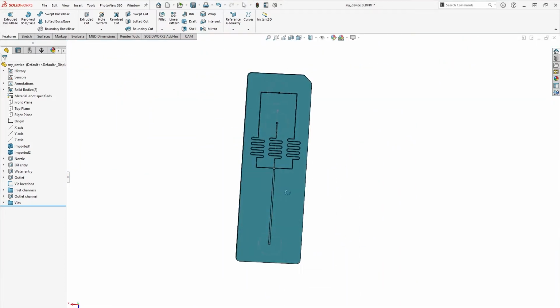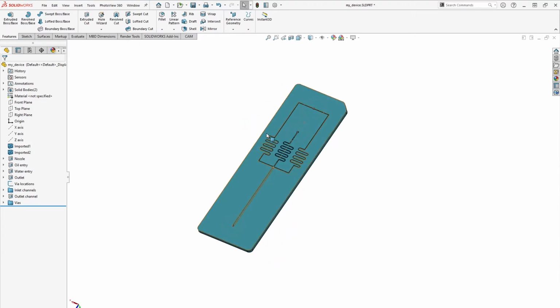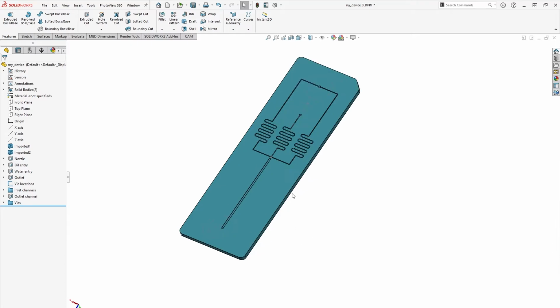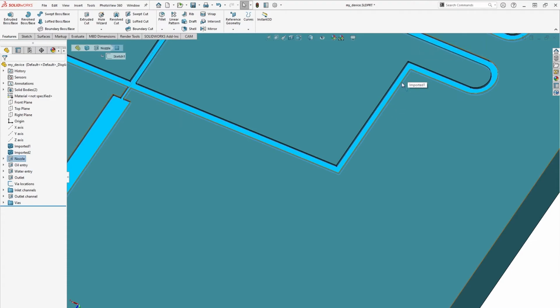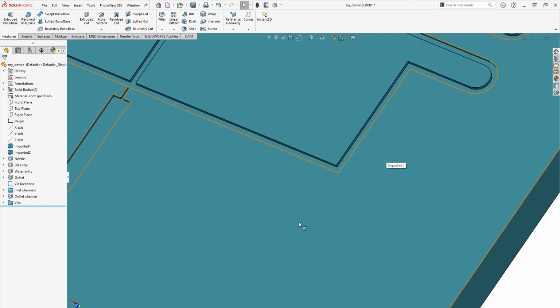Now our device is looking just like our schematic. We aren't quite done yet though. We need to make sure that our device fits within manufacturing guidelines. Specifically, we have a bunch of sharp corners in this device that aren't manufacturable in mold-based processes. Corner radii are covered in another section of the design guide, but as a general rule of thumb, we want to avoid small radii as much as possible.